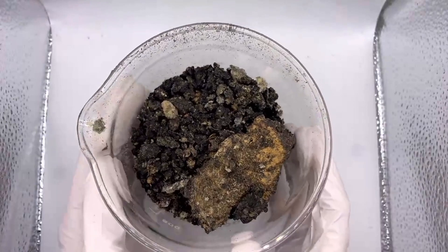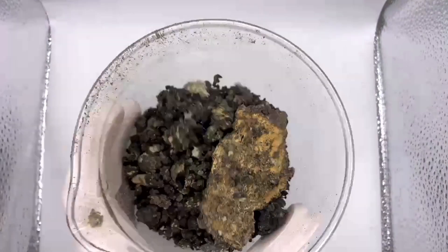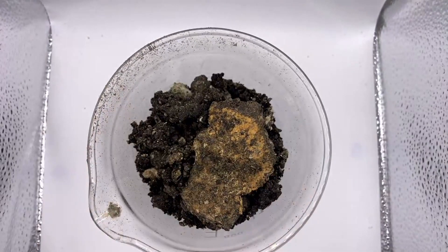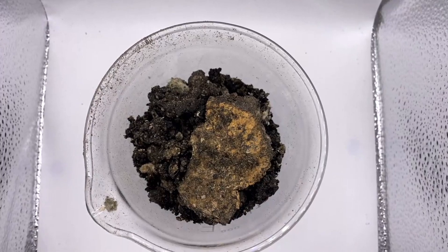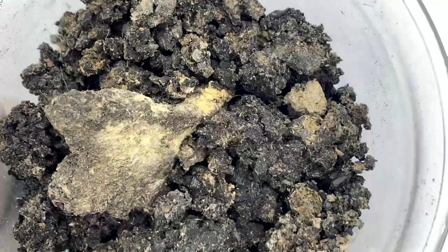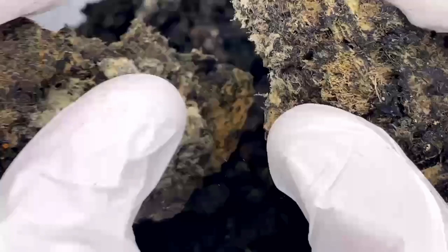Here is a sample of the wastewater treatment sludge we received for this trial. The sample is dry, hard and brittle. A sample like this is quite easy to feed into the tube of the pyrolysis kiln when the particle size is small enough. You can see in the sample that there are some larger particles in the feedstock, so we had to manually break these down in order to get a more consistent feed.